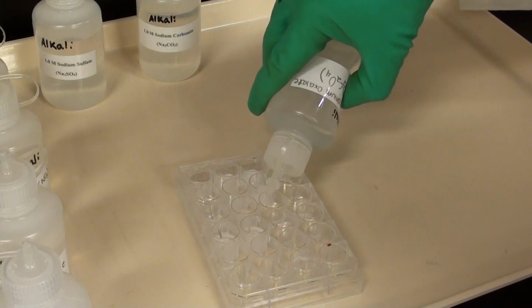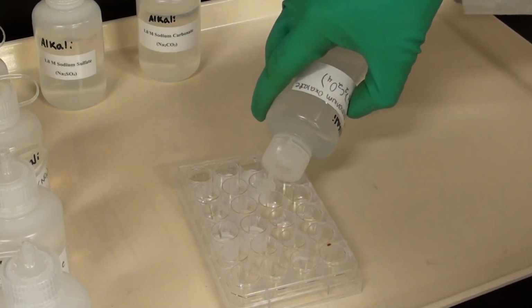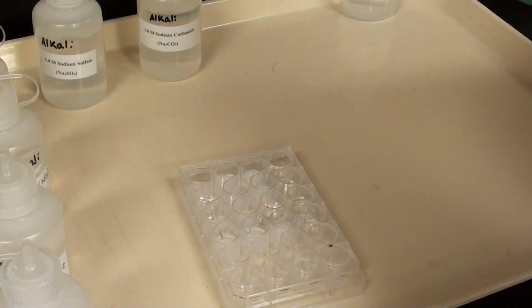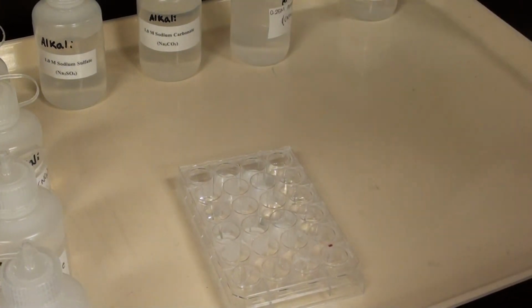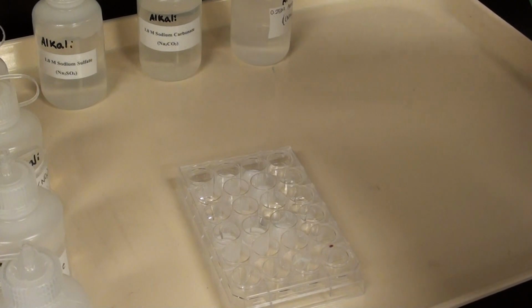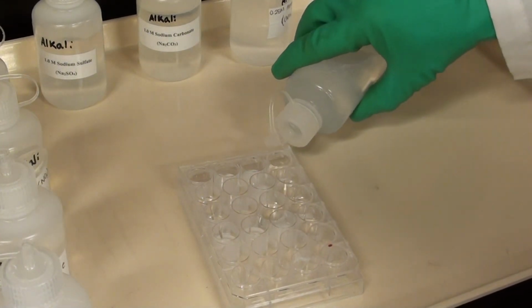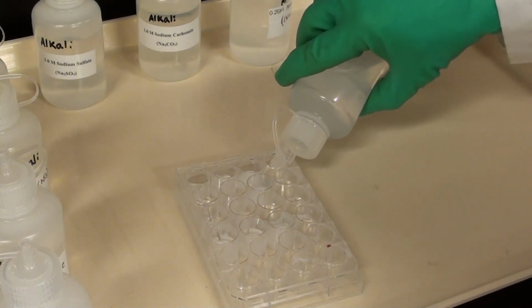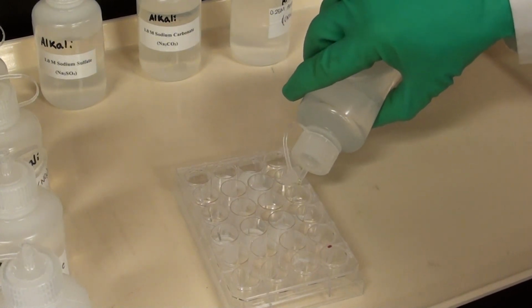And I'm noticing these are all white precipitates? Yes. If you notice any other colors, I would suggest you start over to make sure you actually had a clean well plate. Clean the well plate off first with water pretty well. You can use the sink if you'd like to clean it out with just regular tap water, and then rinse it off with DI water. That's the approach I think I'd take.